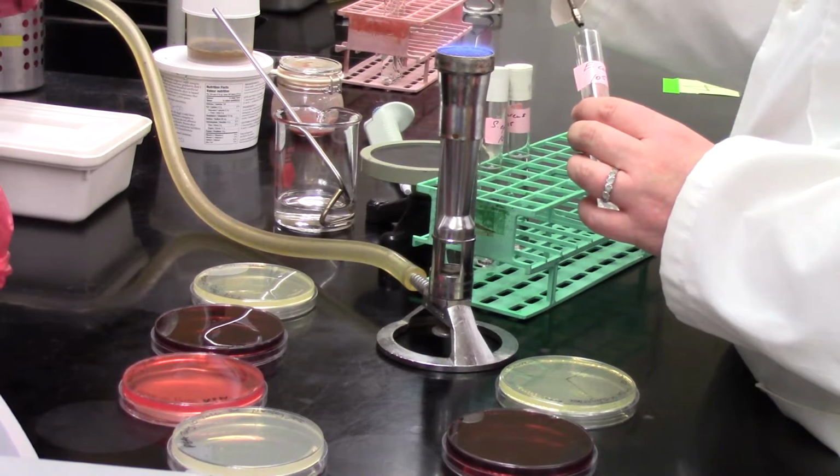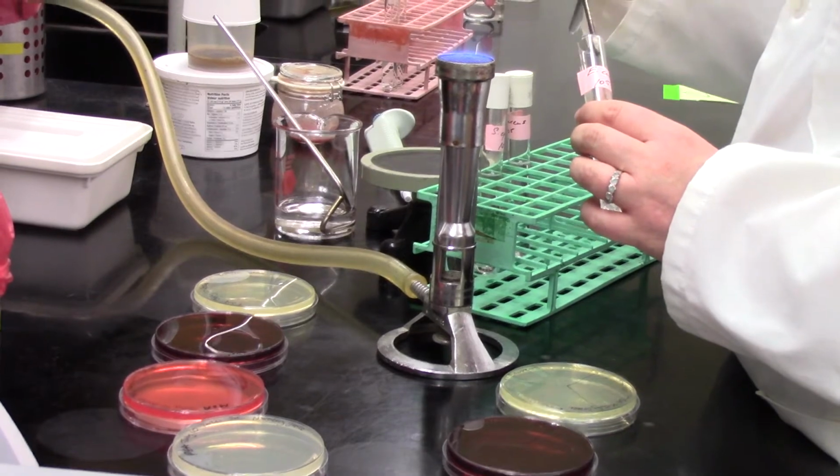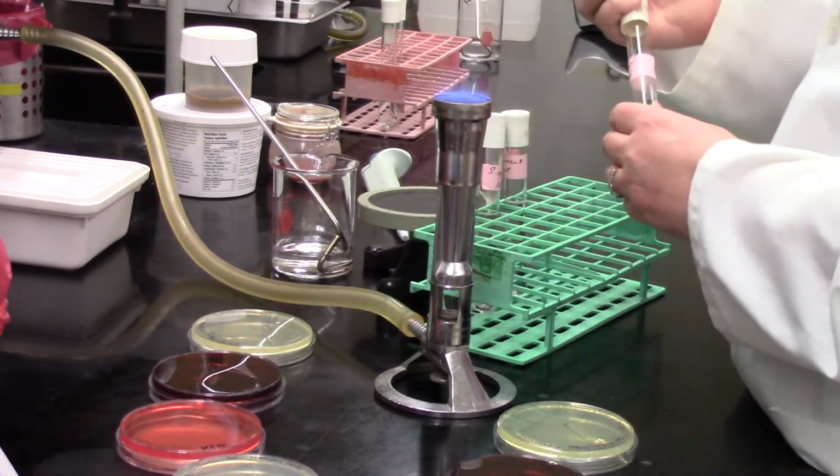See how Sabrina's had that loop right ready to go. She's going to flame.